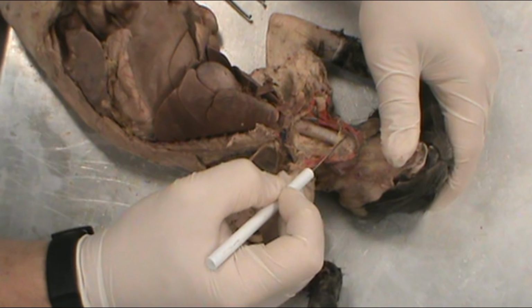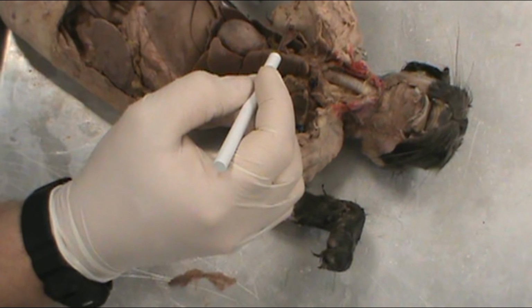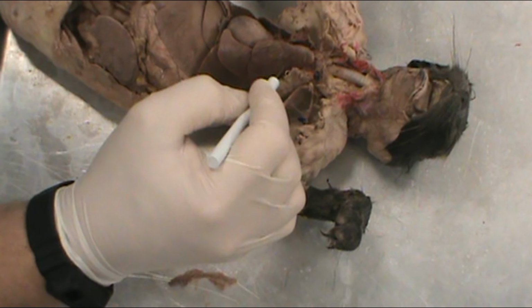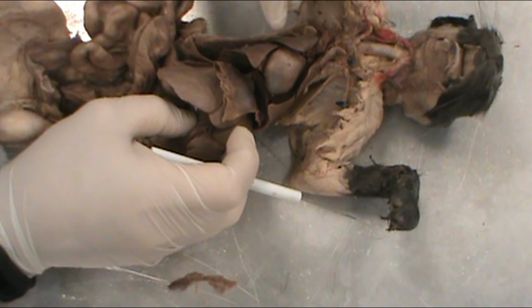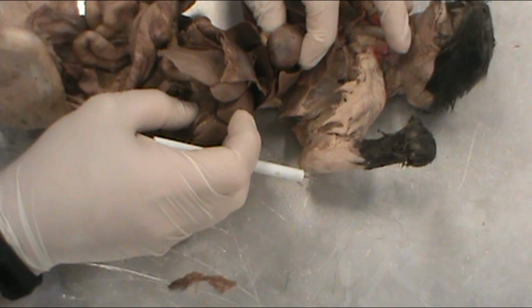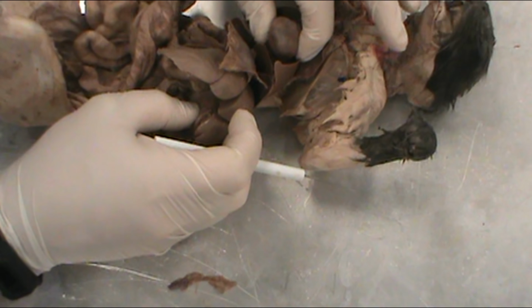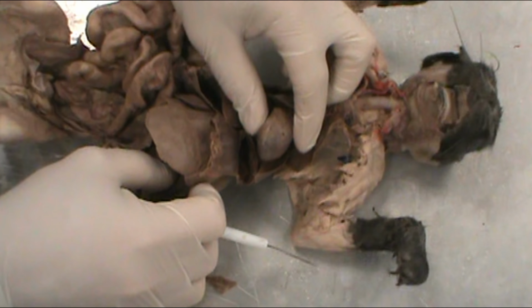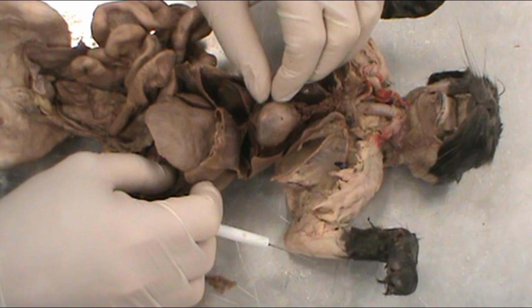The trachea comes on down and will branch inside here and go to the bronchial tubes, which will go into the right and left lungs. So this is a lung, and the other side is a lung right here, both with multiple lobes. Centered in between the lungs, we have the heart, which is a much smaller version of what we've seen before in the sheep heart in one of the other videos. So that should be pretty easy to identify.